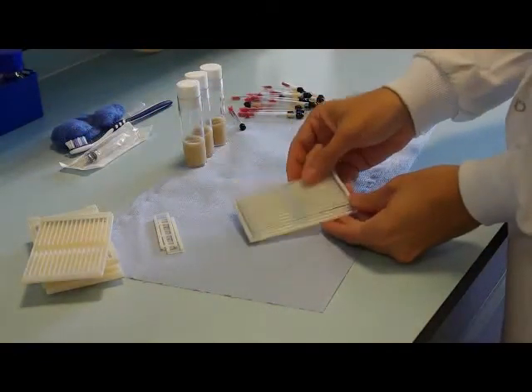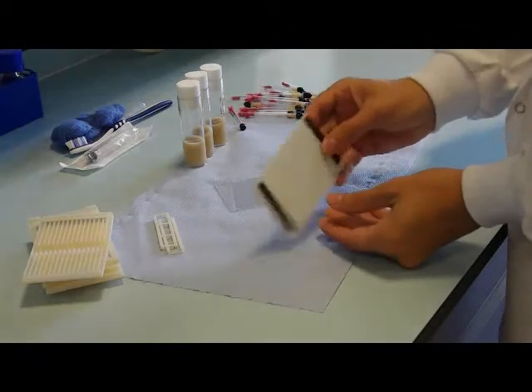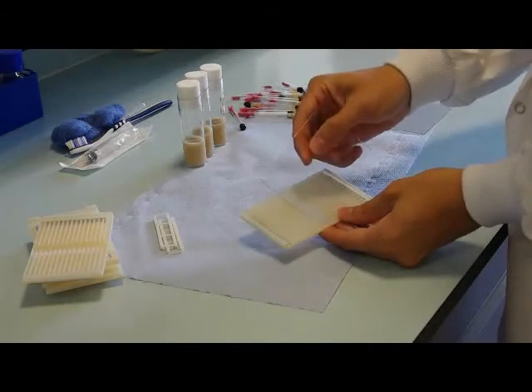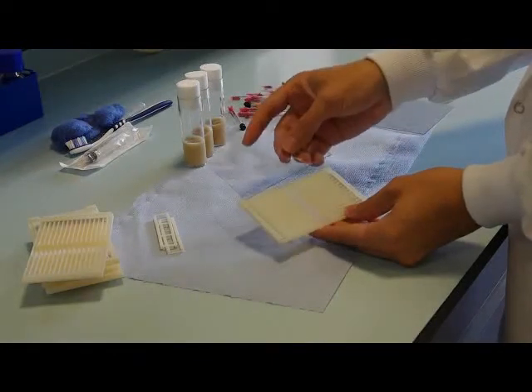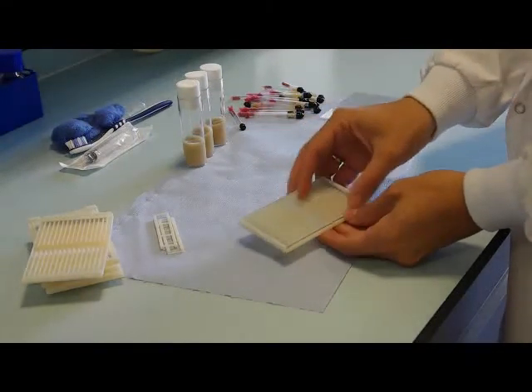This is what the most recent version looks like. Each arena hosts 32 flies into parallel grooves, and all have access to the same source of food. As I'm going to show you, preparation of an arena is very straightforward.